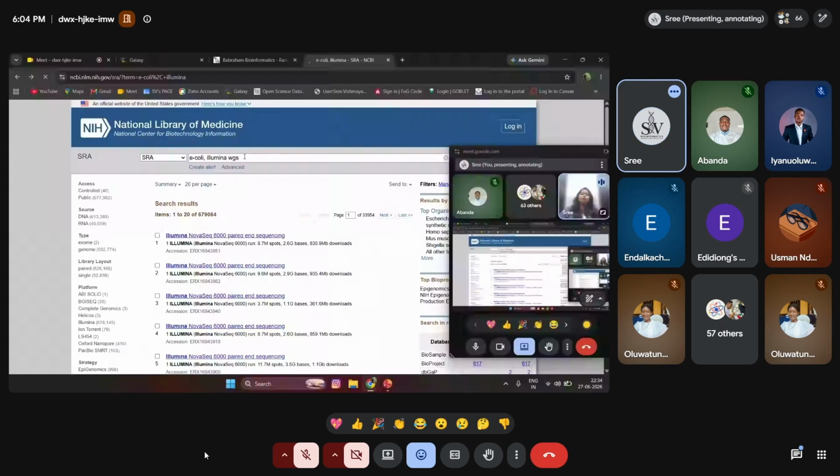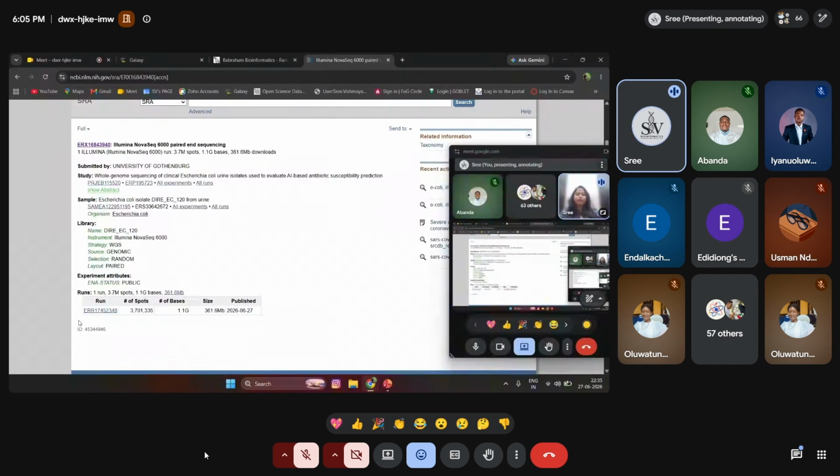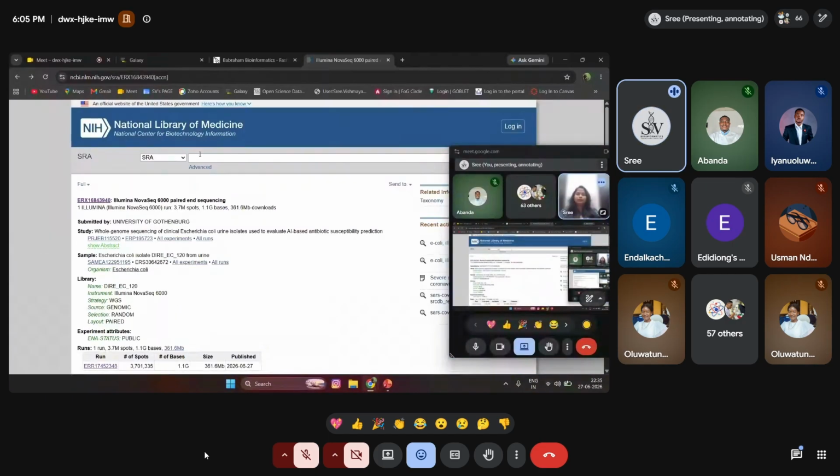You can see this is the run ID. I hope this information is highlighted. If this is not released, we need to pick some other data. This is also not released. Fine. Okay, randomly, I'll go with other data, SARS-CoV-2. It's a COVID sample. I'll go with SARS-CoV-2 Illumina WGS data.